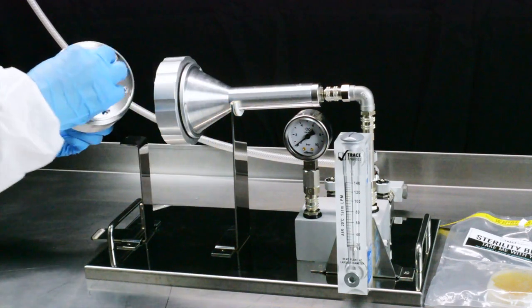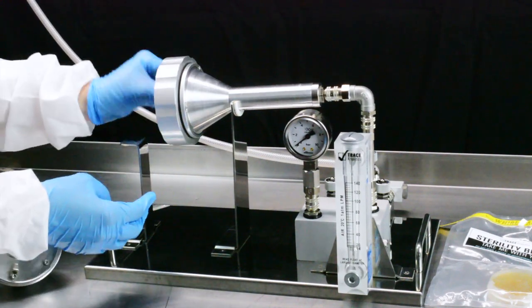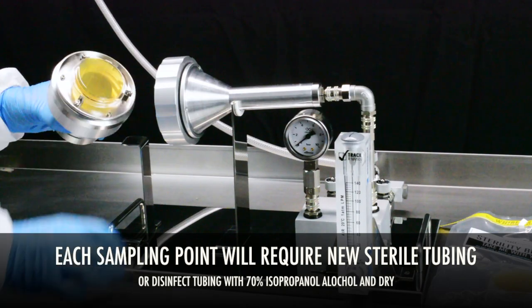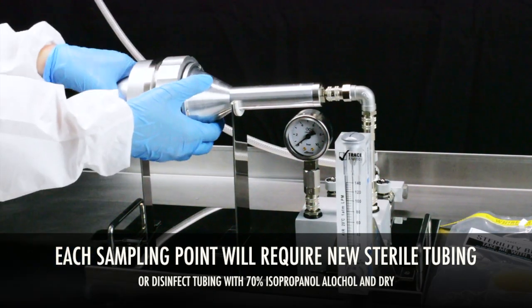Now you're ready to take a sample. Following the same process as before, place a new contact plate into the plate housing. Remove the lid and promptly screw the contact plate housing back into the collar.